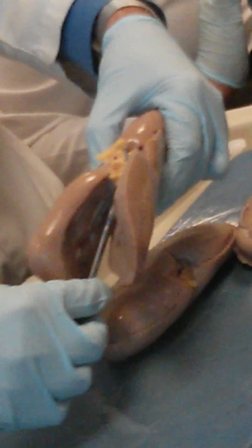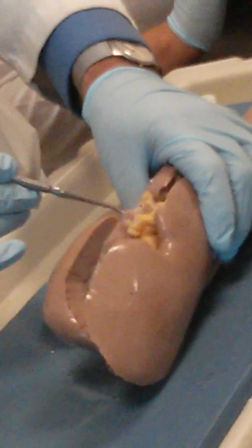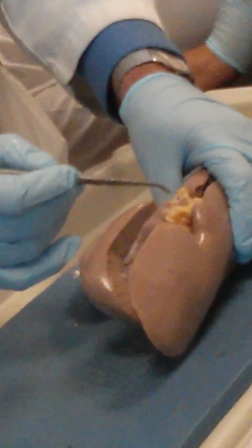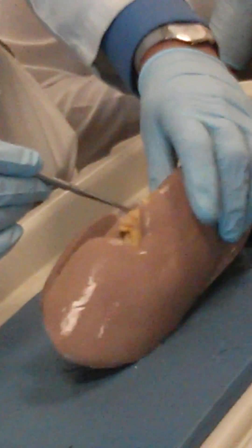You can see two openings here. Because this is a partly injected kidney, if you open the kidney from here, this is the pelvis of the kidney, and going from here you come out here as the ureter — that makes sense. The remaining two have to be the artery and vein. If one maintains its shape, that is an artery; if one is squishy, that is the vein. So you have the renal artery and the renal vein.